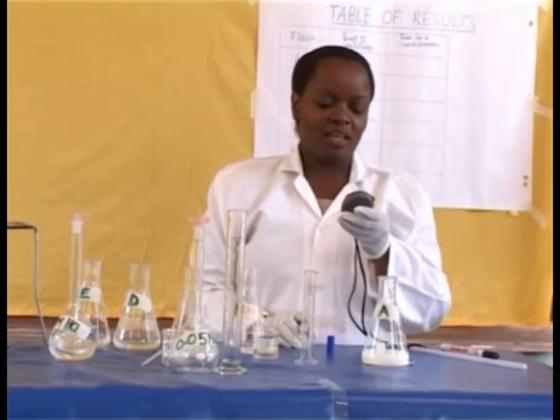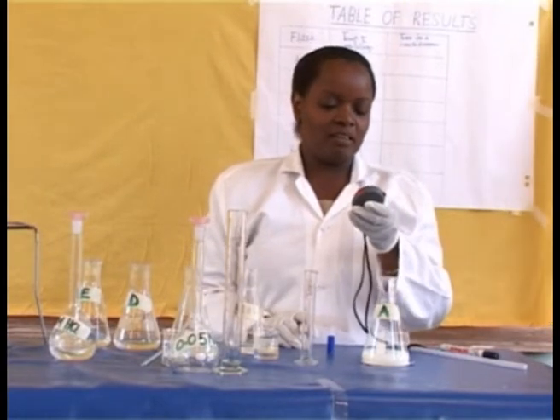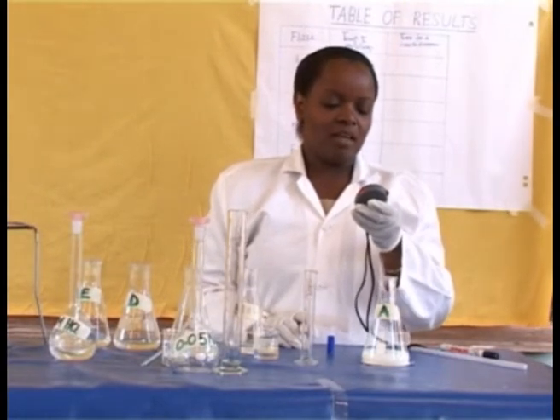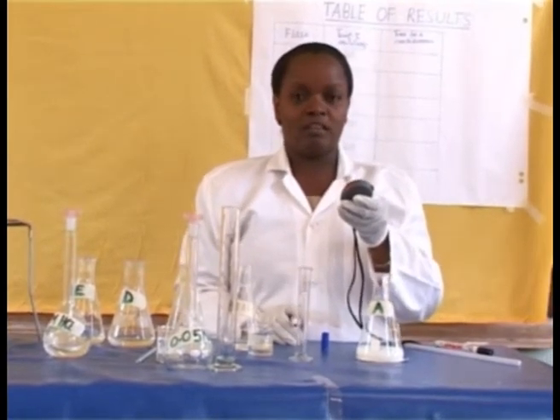The time taken for the cross to disappear in conical flask A is 340 seconds.